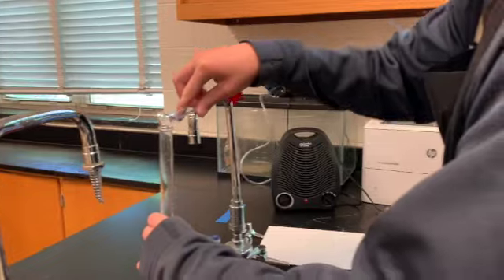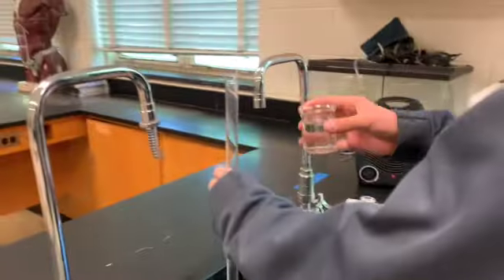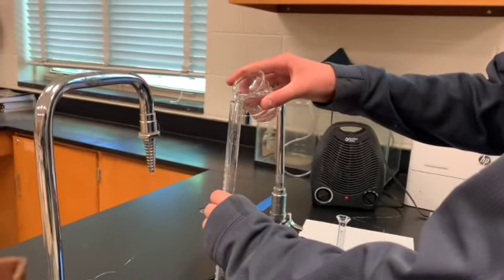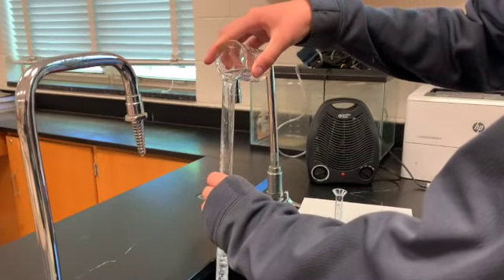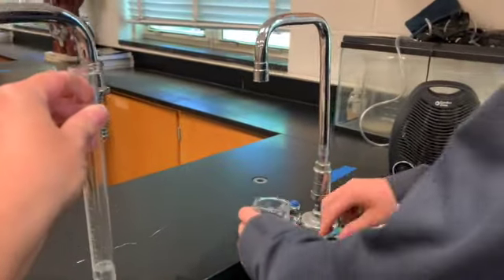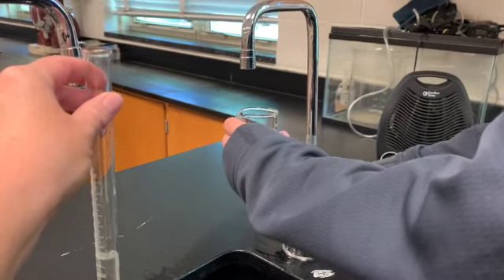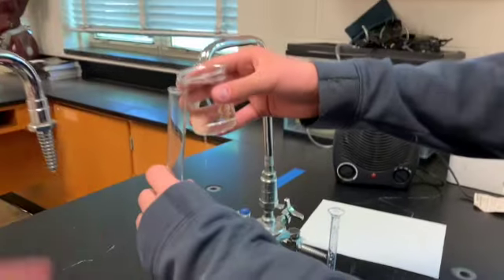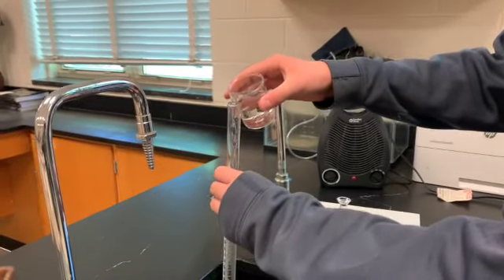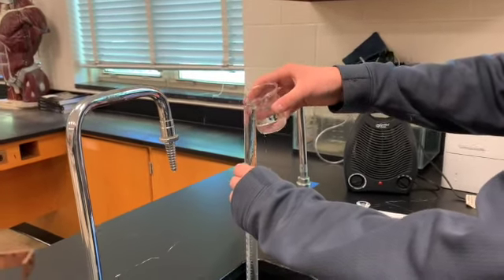All right, great. He's now just going to take water, and that's what's in this beaker, okay? And he's going to fill the gas collecting tube all the way up with water. We don't want any air in this because we don't want air to be the gas we care about. So here, I'll hold that. You refill the water. There we go. Okay, all the way so it's spilling over. Keep pouring. The acid, remember, is in the bottom, and it's not going to come out.